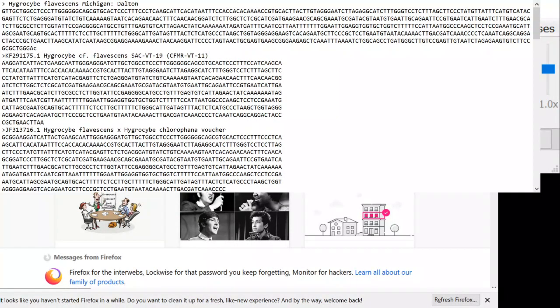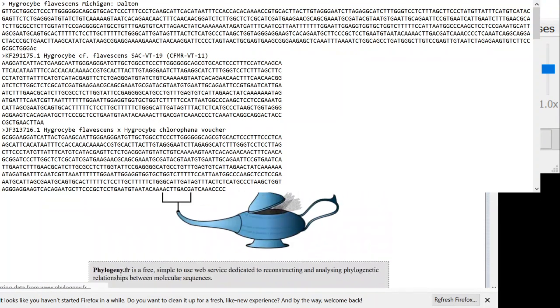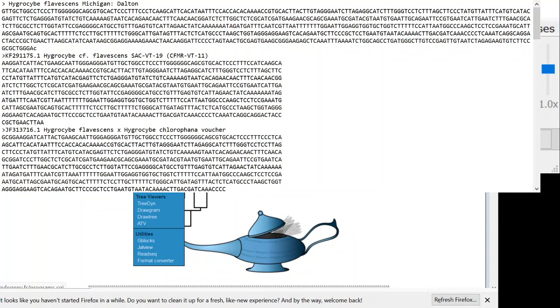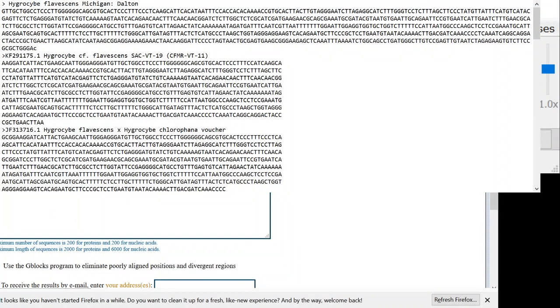So the easiest and quickest way to make a phylogenetic tree is to use a website called phylogeny.fr. So if we go to phylogeny.fr, this is a website in France. And the really cool thing about this is it has a one-click mode. And with one-click mode, it does all of these different steps for you. All you have to do is upload the FASTA, and then it'll do an alignment, so it aligns everything, and then it calculates the phylogenetic tree, and it visualizes it and does everything.